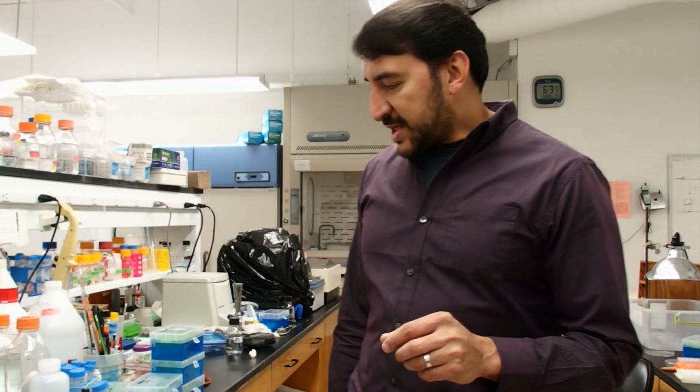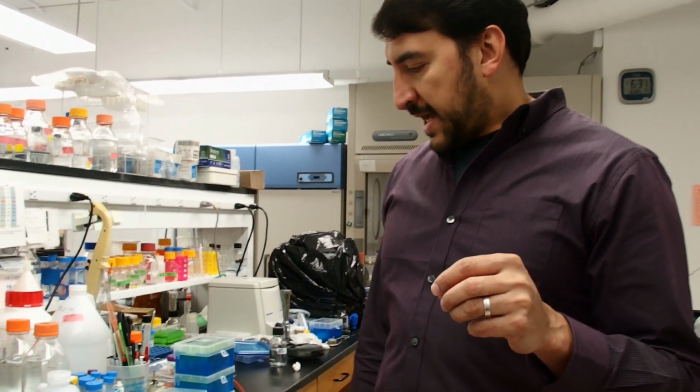So to do this we need to make a filter cup to catch the agarose during the centrifugation process and separate it from the aqueous DNA phase. It's important, if you use this method for setting up a ligation directly, that you use TAE buffer in your gel, because TAE buffer is compatible with most molecular biology enzymes like ligase. TBE buffer is not compatible with that.